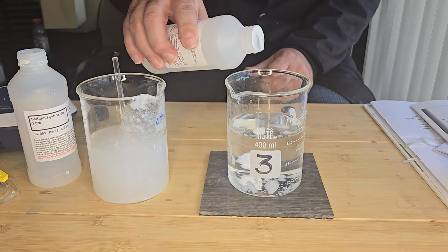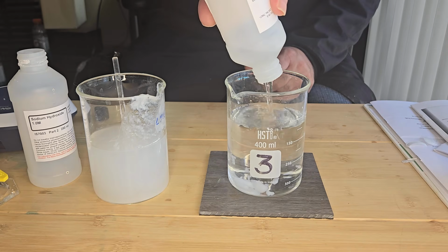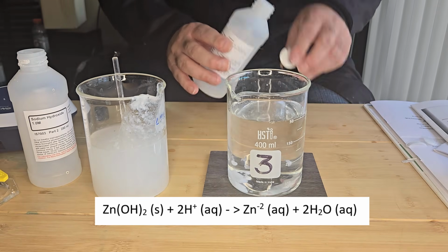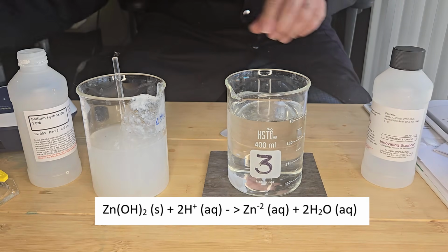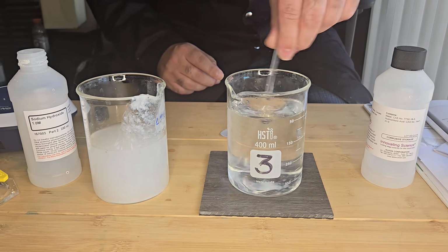But when we add enough hydrochloric acid, that precipitate, the zinc hydroxide, dissolves completely again with soluble zinc. So now we have soluble zinc again.